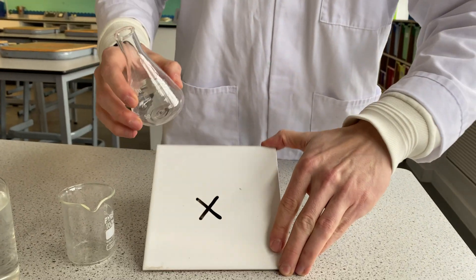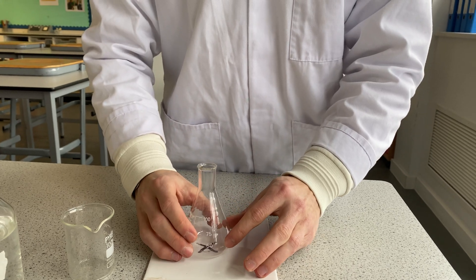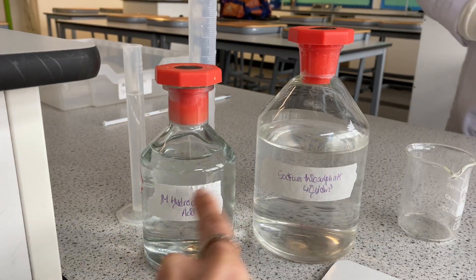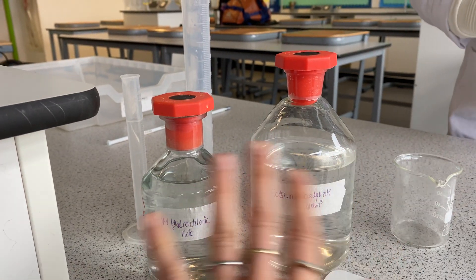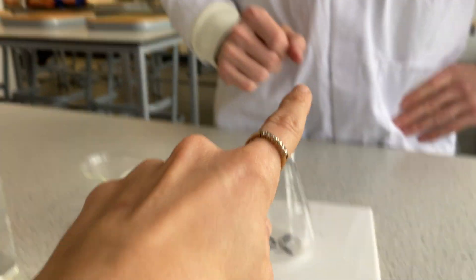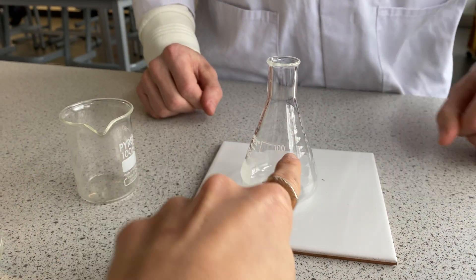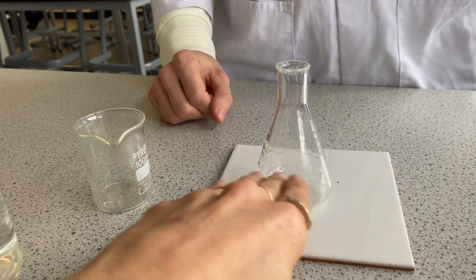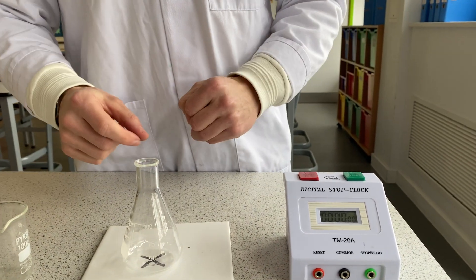If we do this reaction on top of a tile with a cross on it, then as that solid precipitate is formed, that cross will disappear. These two solutions are clear — we can't see any solid — but when we mix them together, they form a solid. We're going to know the reaction happened because the solid will cover the cross, and you won't be able to see it.